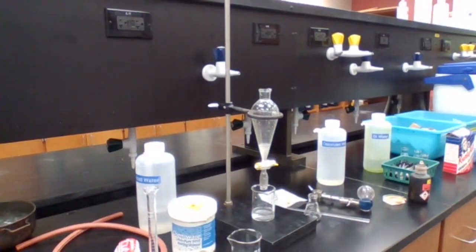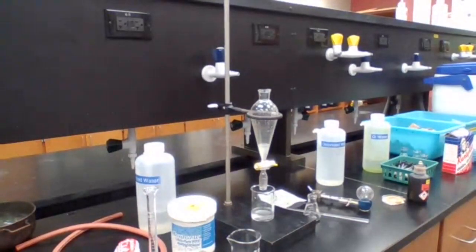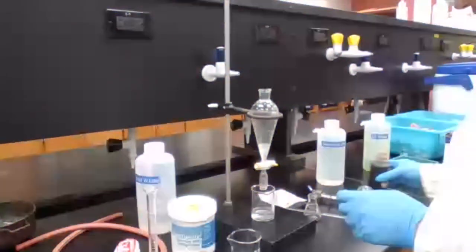Okay. Is it just the one chemical test that you're doing, or two? Are you using bromine also or no? Just the Baeyer's test? Okay, just the Baeyer's test. We could do both, but it's just one.